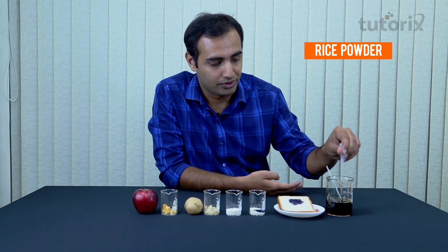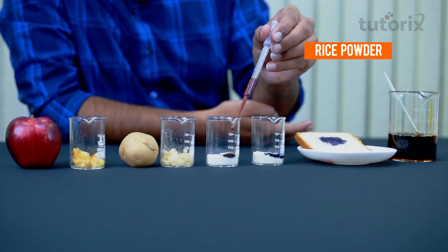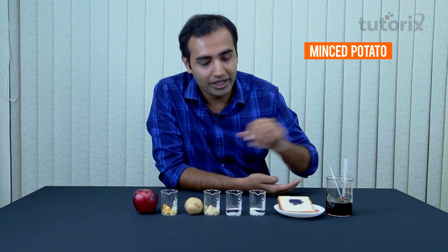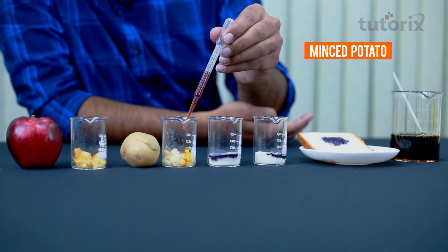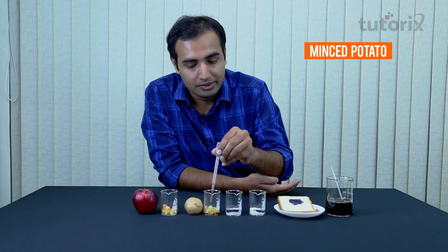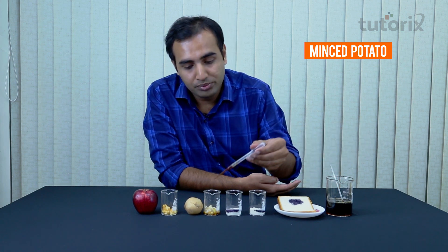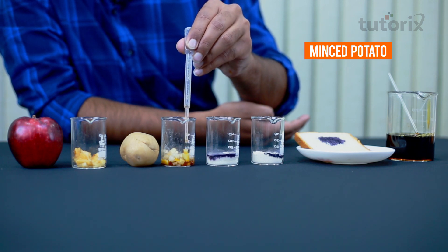Let's go ahead and try it with the rice powder. Once again you can see that the color has completely changed to blue-black, and we have also learned that rice contains abundant amounts of starch. Now let's try it on the minced potato. When I put the iodine solution on minced potato, it doesn't instantly change to violet like our previous food items. But we know that potato contains a lot of starch, so we pour a little bit extra and leave it for some time so that the potato changes its color to blue-black.